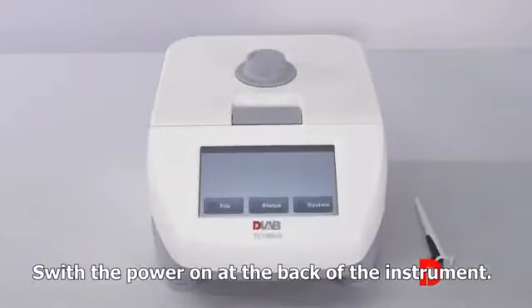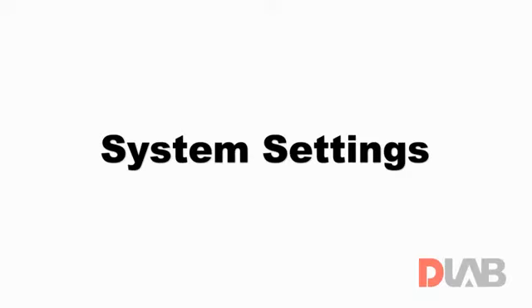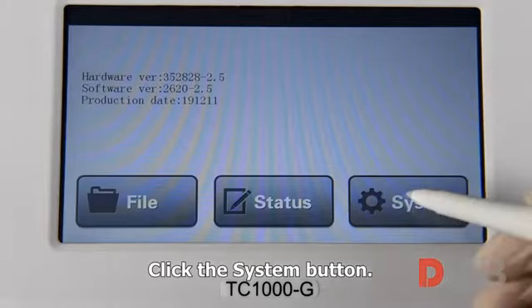Switch the power on at the back of the instrument. The screen displays the home page and the self-test starts. System settings. Click the System button.